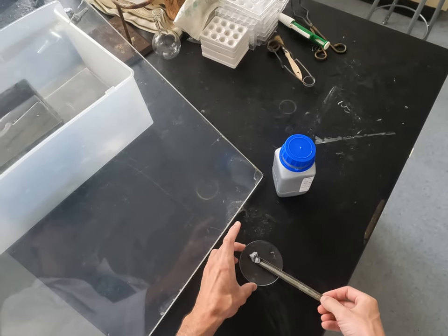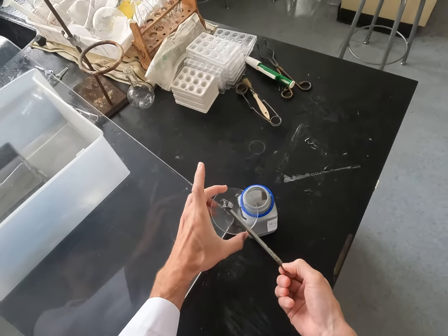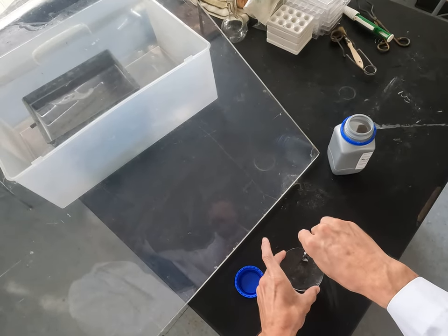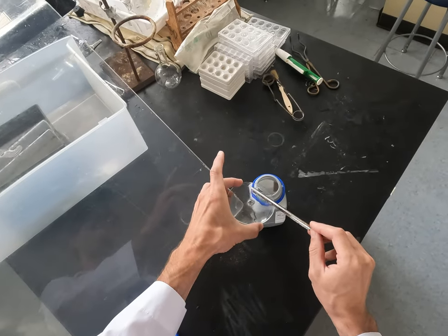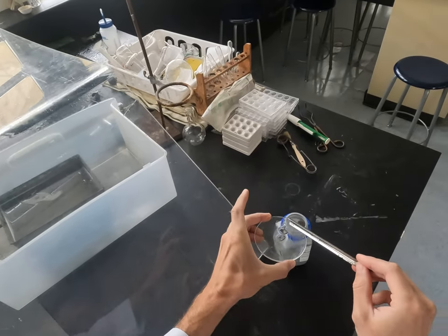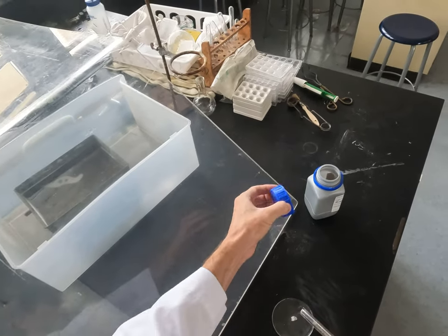I'm going to put most of this back in the jar. I'm just gonna cut this in half again and put even more of it back in the jar. It's kind of silvery on the inside, but it combines with the atmosphere really fast. It's in mineral oil. So I have a small chunk of potassium here.